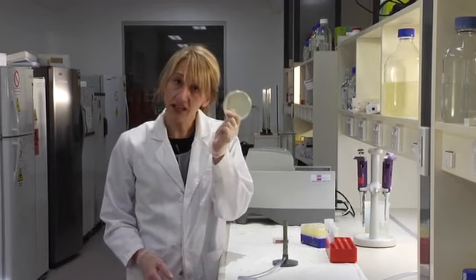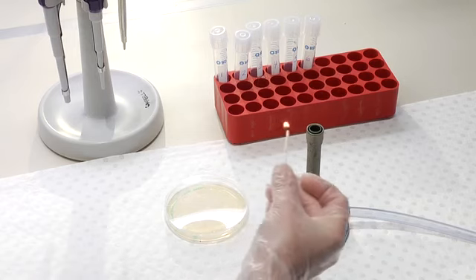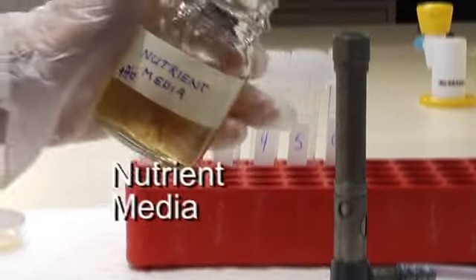So to check which of these colonies contain our plasmid with the insert, we're going to take each colony and grow it in culture over time. So first, we need to set up some tubes of nutrient media with antibiotics.